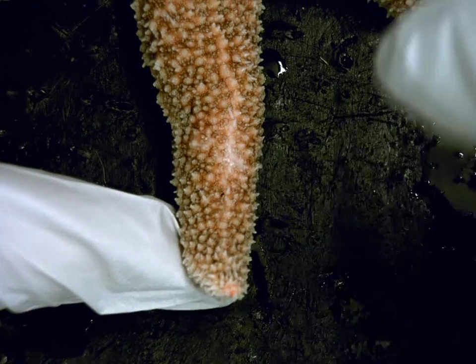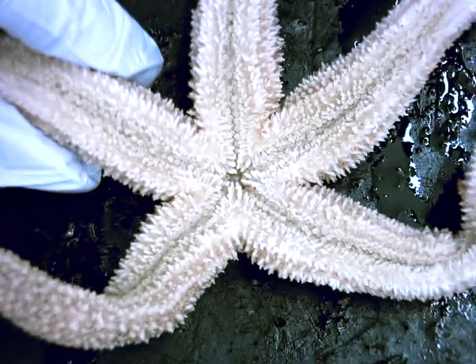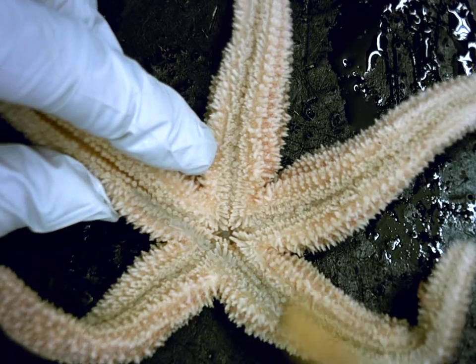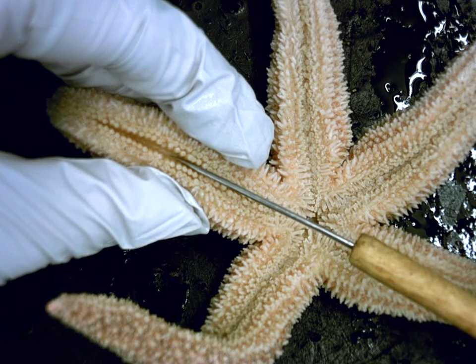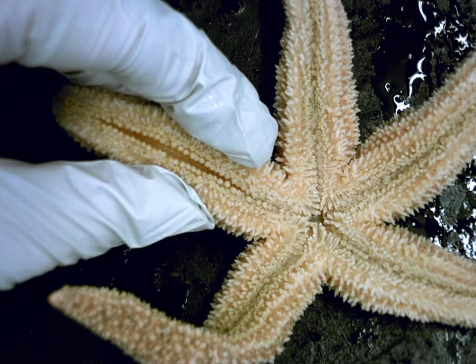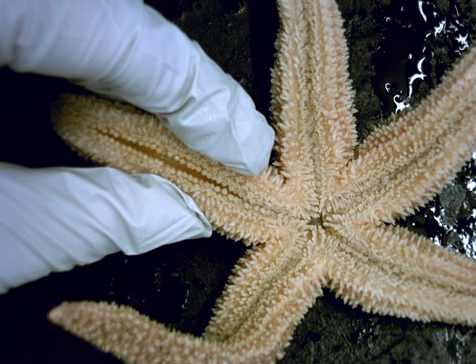All right, now they also have on the oral side of the animal, let me zoom out, this area of indentation, which is found right here, and I can kind of open the arm and you can see there's definitely a pocket of space down in there, and that's actually known as the ambulacral groove. And ambulacra again is the name of an arm, so that's the groove in the bottom of the arm.